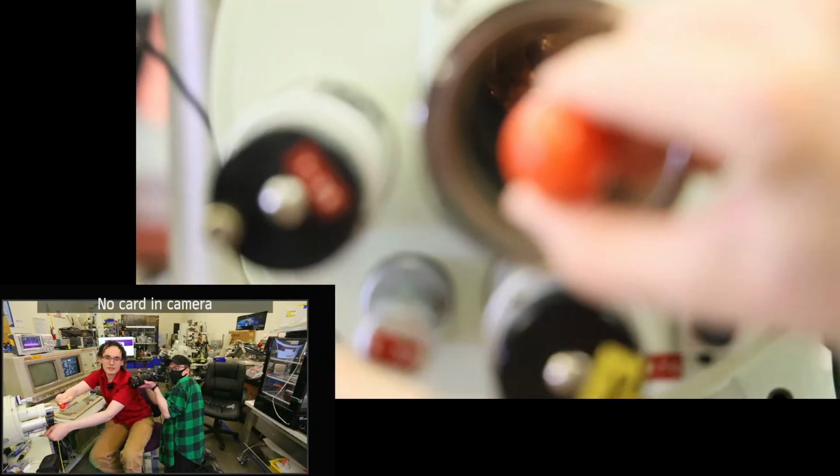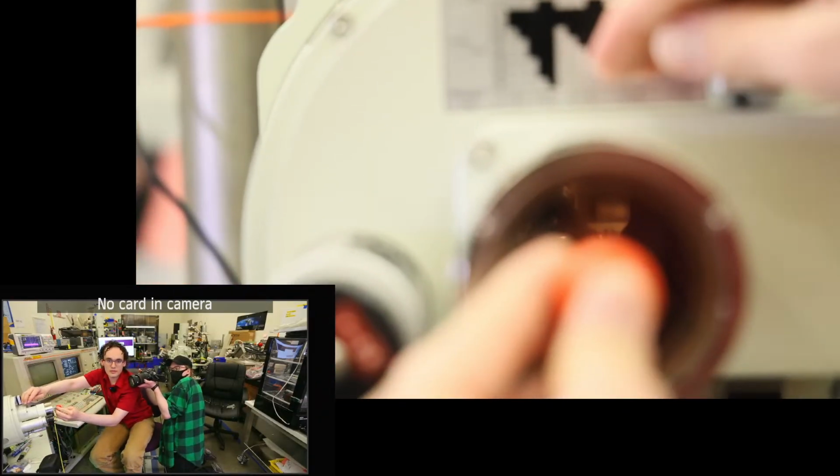Yeah, doing this without looking is hard. I need more practice, apparently. And then the other thing is I had the sub Z at the wrong height. So there we go. Oh, that's a great shot of it. Okay, so we're threading in. I think I'm threading in. Oh, I'm tilted too. There we go. Now we're threading in.